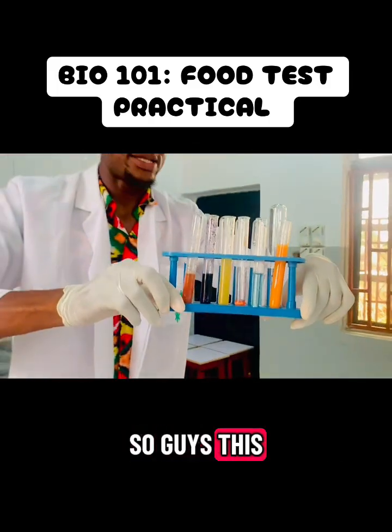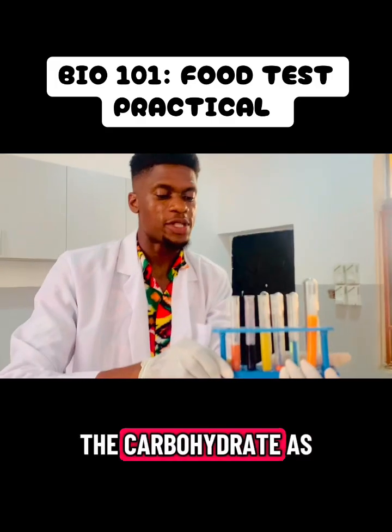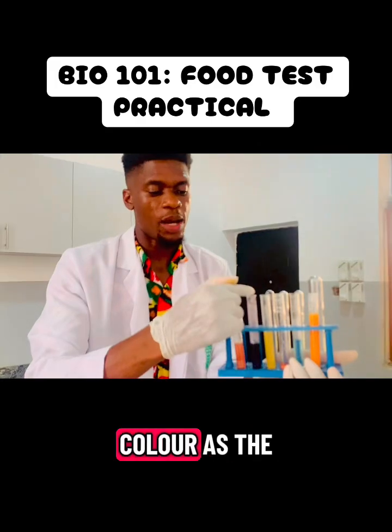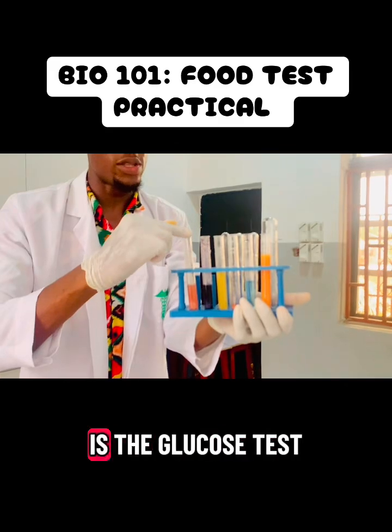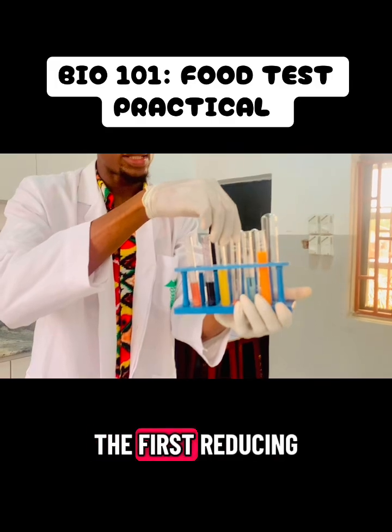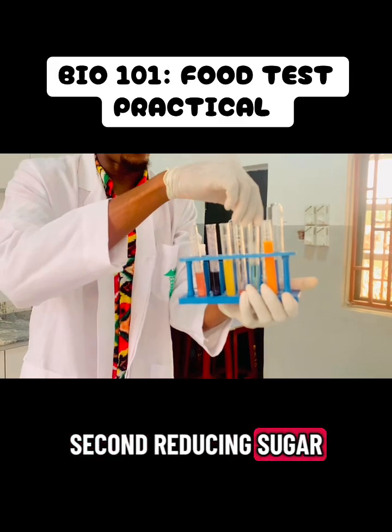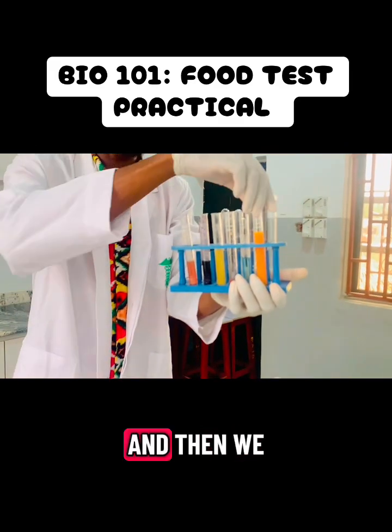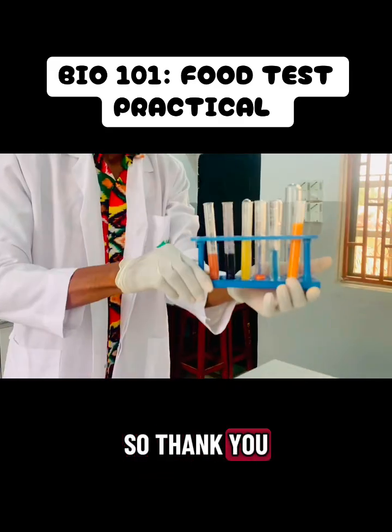So guys, this is what we have. So this is the carbohydrate, that's the starch, the blue black color, that's the protein there. Yes, that is the first one, which is the glucose test. We have the first reducing sugar that didn't change color, and then the second reducing sugar that changed color, and then we have fat.